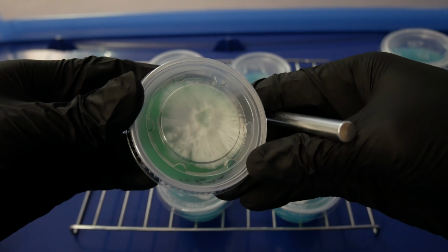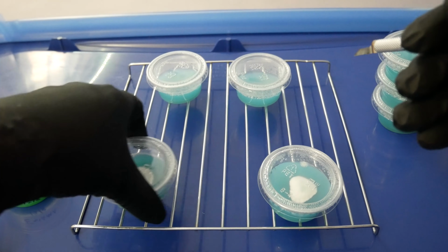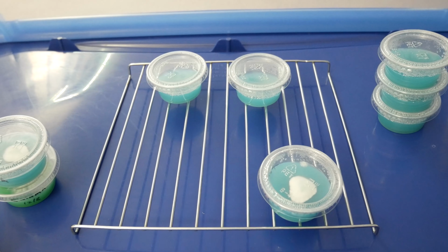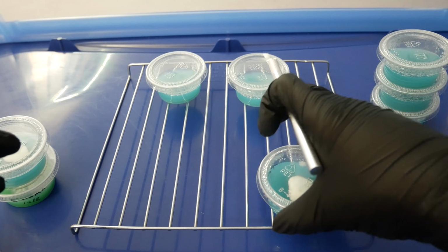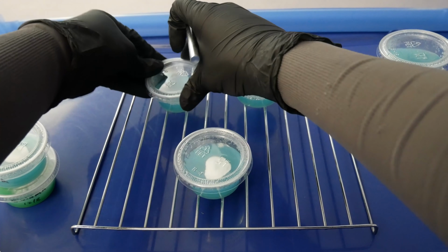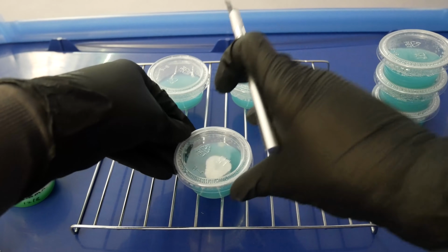So whether you're starting from spores to agar or clone tissues to agar, it's important to clean your plates up from any contamination before we introduce the cultures to grain or liquid culture. And when I say culture, I'm pretty much referring to the mycelium colony that I'm working with. The reason why agar is preferred is because it gives you a two-dimensional space to work on your mycelium. It's a lot easier to spot contamination on an agar dish than it is in a grain jar or a liquid culture. There's really nowhere for the molds and bacteria to grow except for on the surface of the agar.